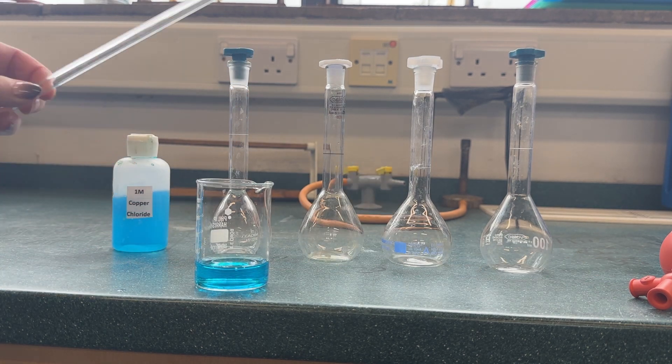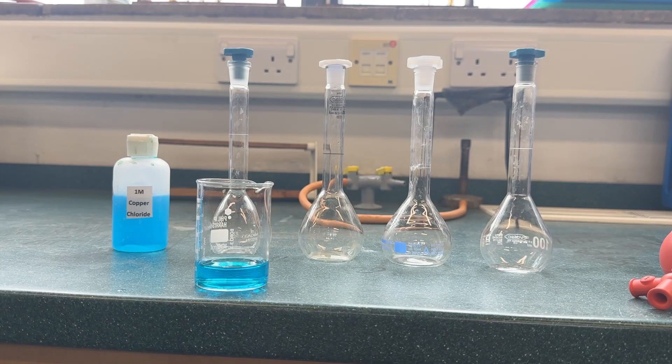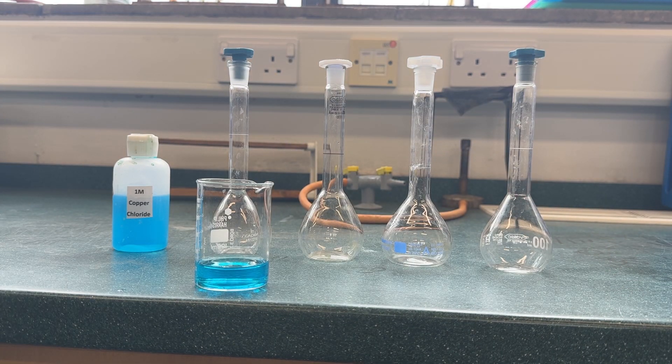Here we have a bottle of one molar copper chloride solution, which is blue. We're going to do some accurate dilutions to make some standard solutions.